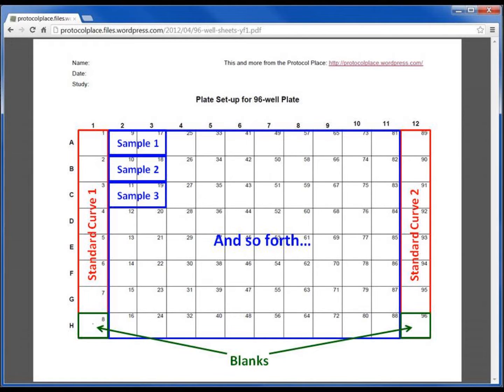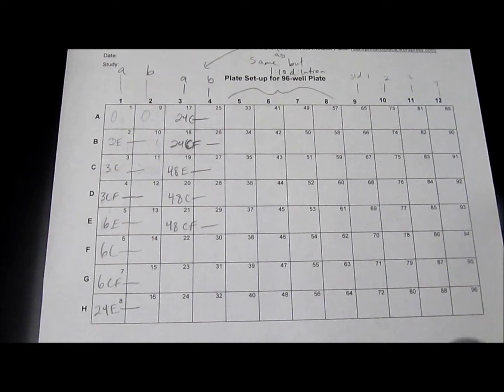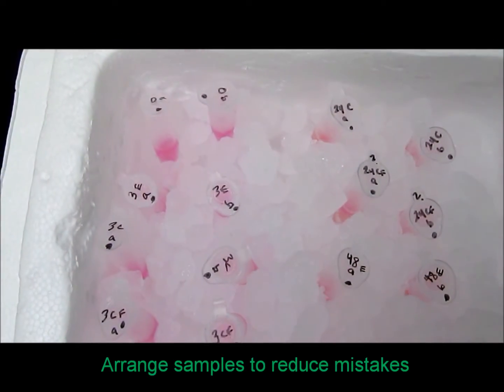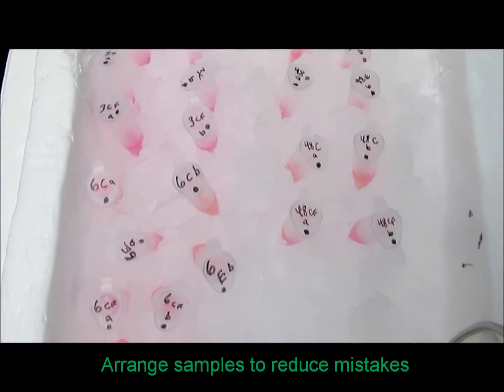Note that each sample shown here is measured in duplicate. By averaging duplicate measurements, variations in the assay become smaller, and our measurements are more accurate. Arranging duplicate measurements side by side makes pipetting and data analysis a little easier. Once your samples are planned appropriately on paper, arrange them in the same order in your icebox or tube rack.